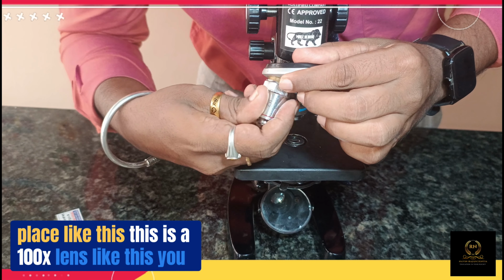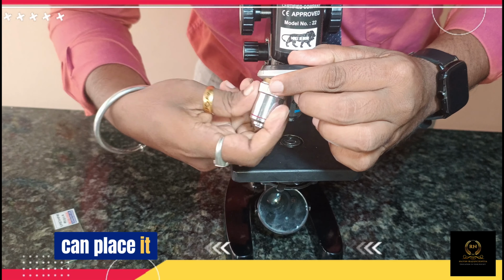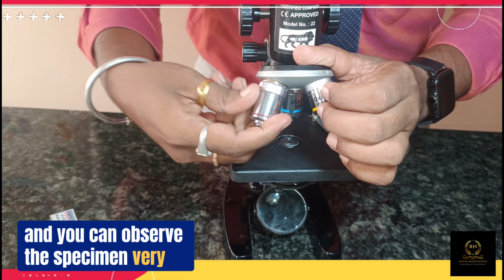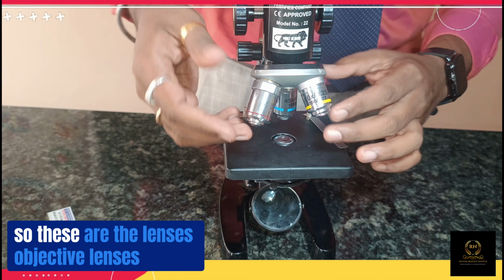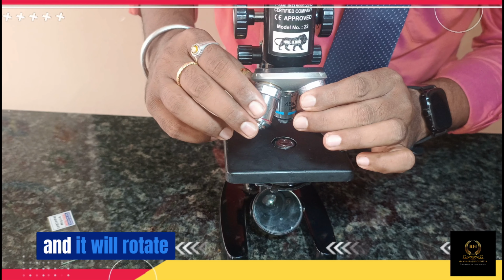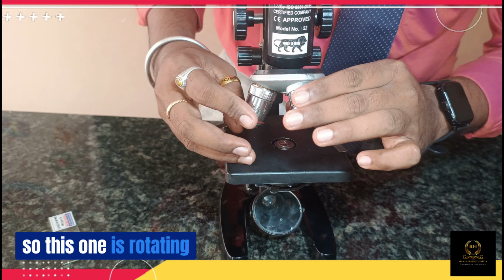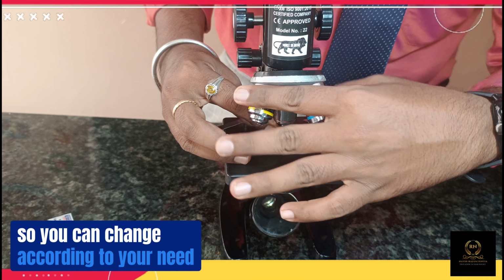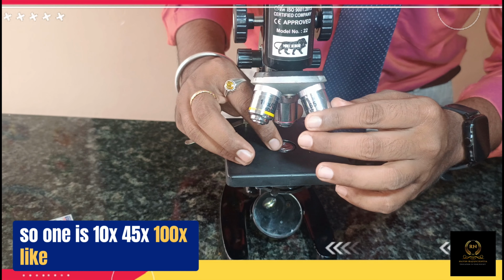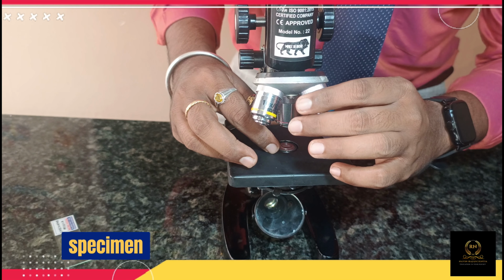This is a 100x lens. Like this you can observe the specimen very clearly. These objective lenses rotate, so you can change them according to your need. One is 10x, 45x, 100x, and like that you can zoom the specimen many times and see.